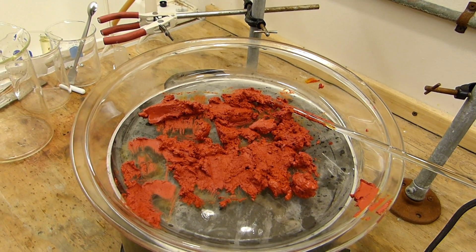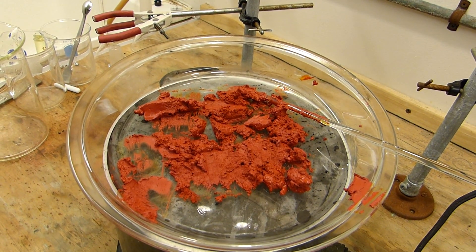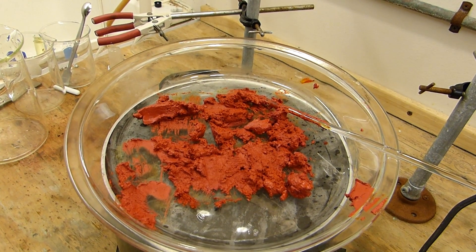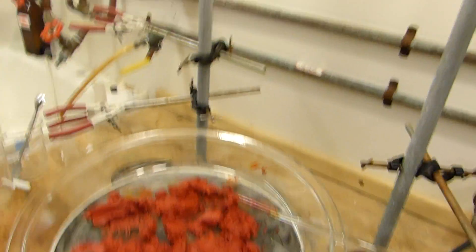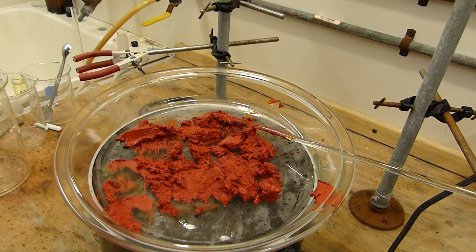I've got it on the hot water bath, it's steaming up already. I'm just going to let it sit on here and see how much nitric acid we can drive off. This is giving off nitric acid fumes, so make sure they're all getting sucked out and make sure there's nothing that you can corrode. But everything in the lab is already super corroded, so I'm not really very concerned about that.